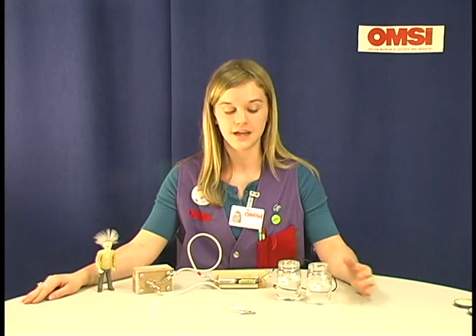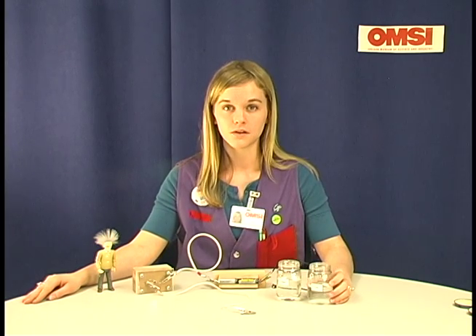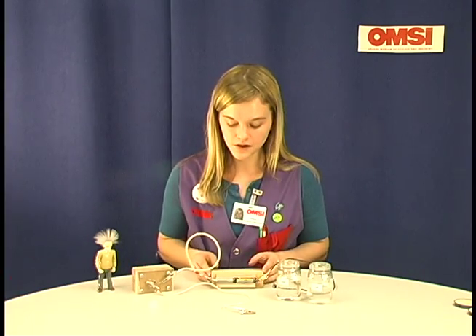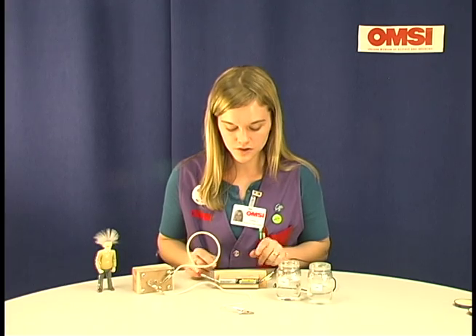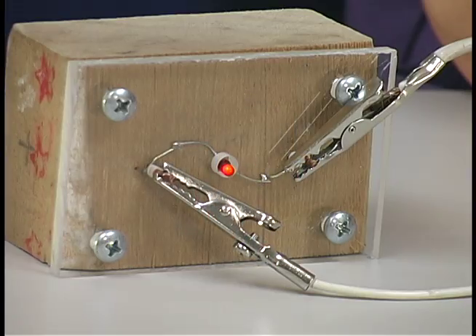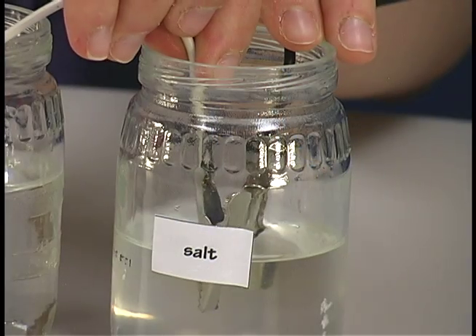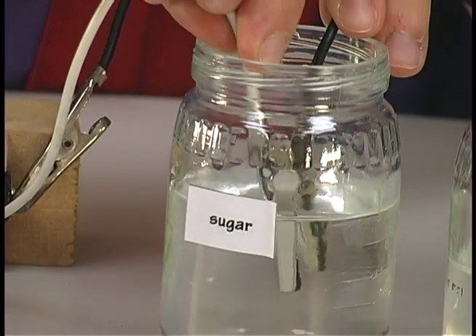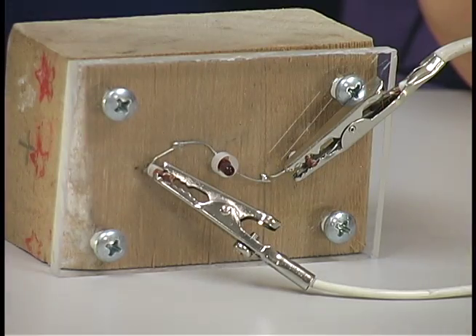Once the students are done with all of their tests, there are still two mysterious white powders yet to be identified: salt and sugar. So in order to figure out which one is which, you can do a conductivity test. I have here batteries hooked up to wires, hooked up to nails, and hooked up to an LED light. To see that it works, all you have to do is put the clips together and you'll see that the bulb lights up. When you stick them in the salt water you'll see that the bulb will light up, but when you put it in sugar water the LED light does not light up.